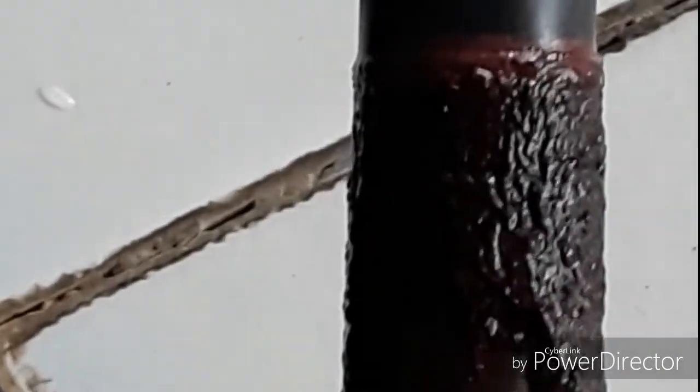You can just see on this side also, and such a beautiful covering has come. You can just roll it and see. That's the copper. With a spatula you can scrape it out, or I'll just show you how it looks. So that's the copper. Copper has got deposited at the cathode during the electrolysis of CuCl2.